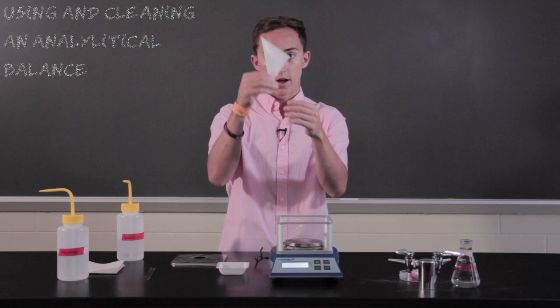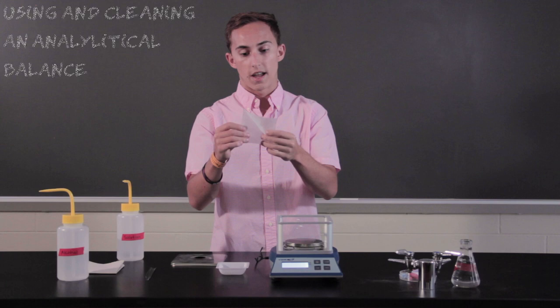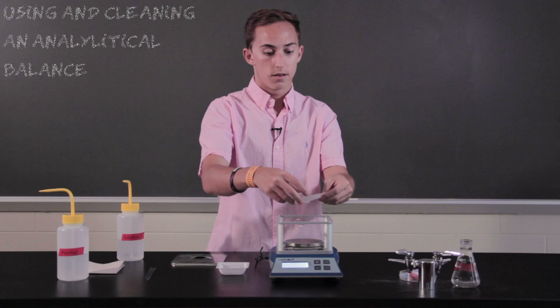cross like this, like a triangle, and you're going to want to do the other just the same, here, so you kind of have like a kite formation. And you'll put your sample in the weigh paper, and again, you'll put it on.